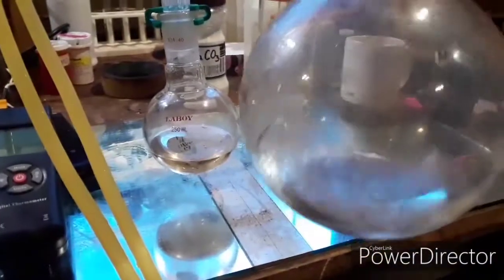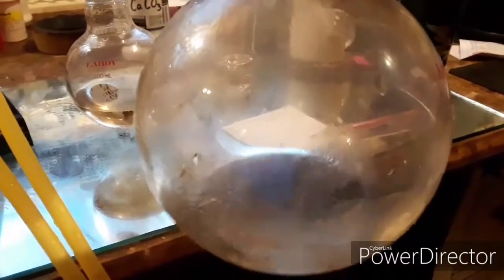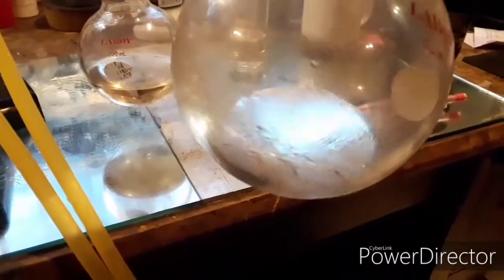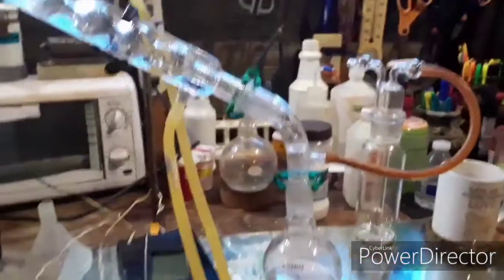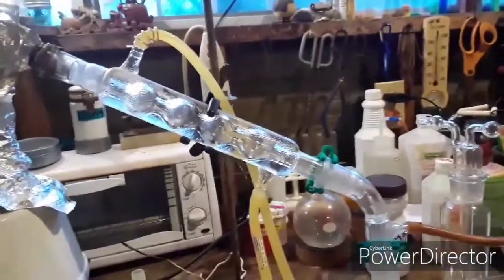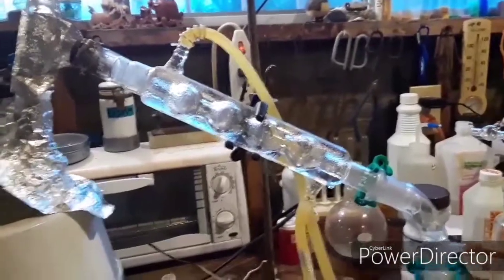There's got to be some azeotropic content and other impurities in here, because when this is boiling over it's coming over at about 150°C. My thermometer was a little over-immersed so it was probably a little less — around 130°C. I'm not up in the mountains or anything so I'm at relatively normal atmospheric pressure.